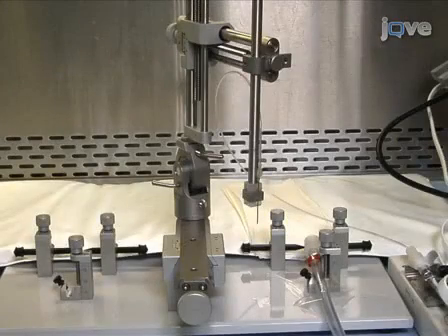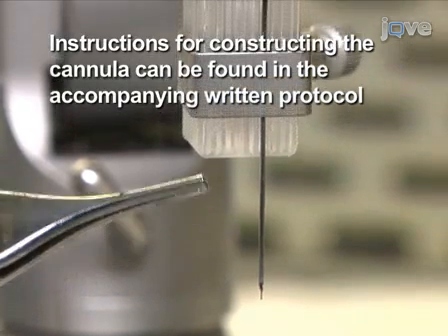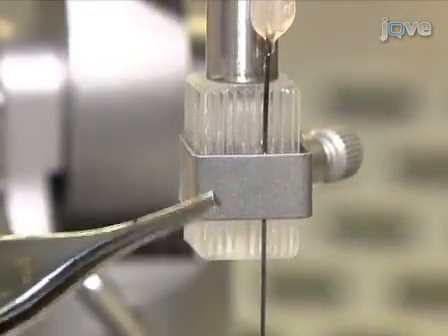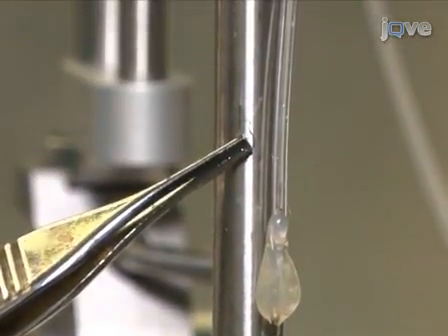Since a reflux-resistant CED cannula for rodents is not yet commercially available, construct a cannula consisting of 3 parts. A 100 micron diameter piece of silica tubing through which the infusate flows, a rigid metal needle for structural support, and flexible Teflon tubing for loading the infusate.